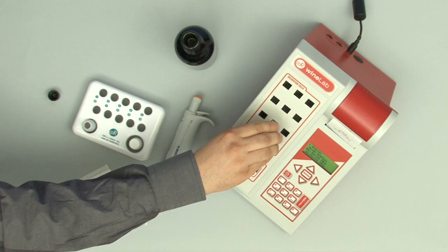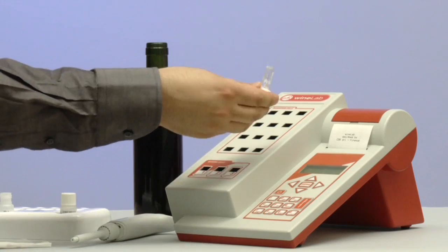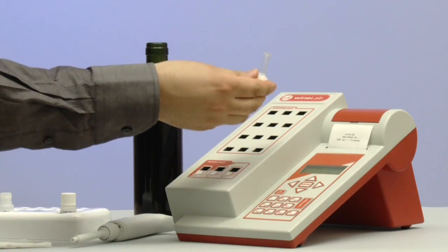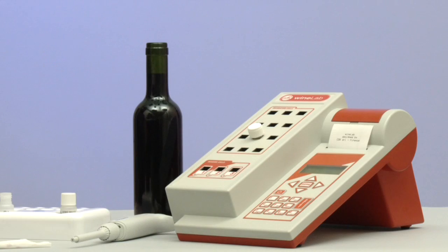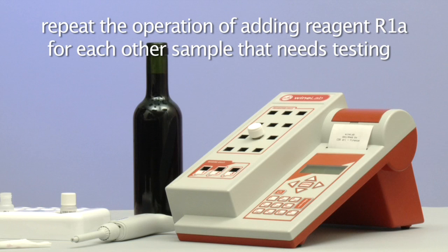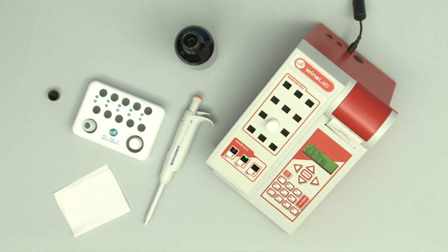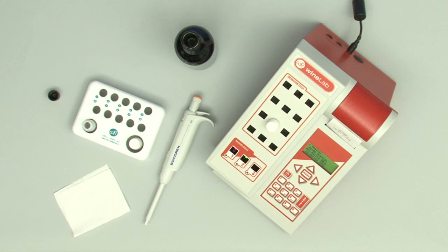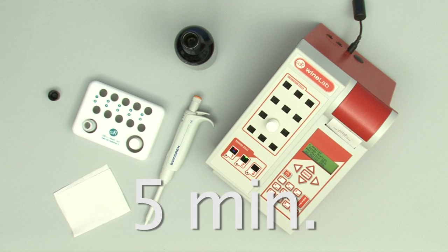Add 50 microlitres of reagent R1A to the test tube containing buffer R1. Then, gently shake the test tube three or four times by inversion and place it again into the incubation cell. Repeat the operation of adding reagent R1A for each other sample that needs testing and leave the test tube to incubate for at least five minutes.